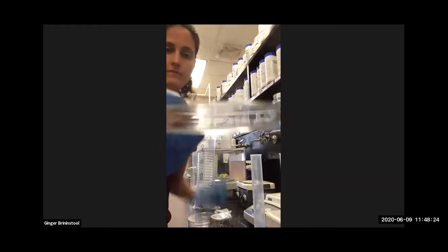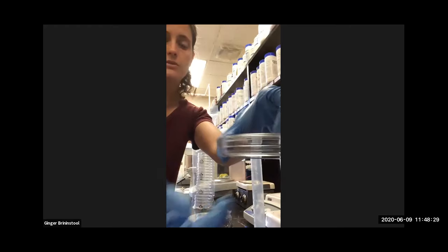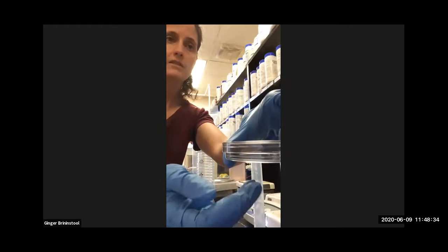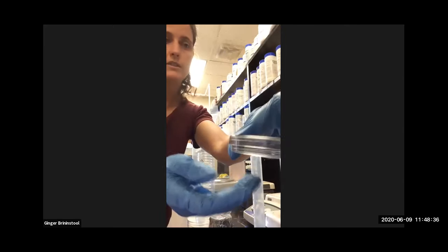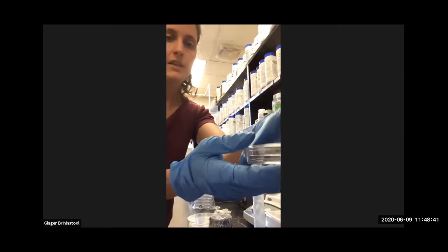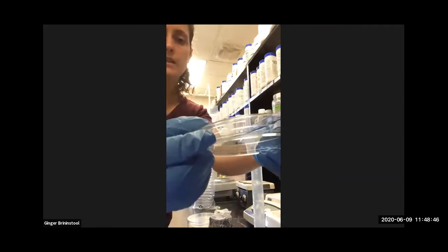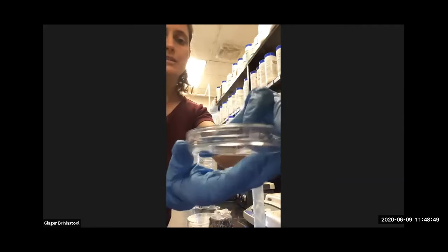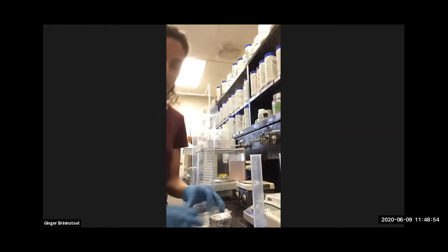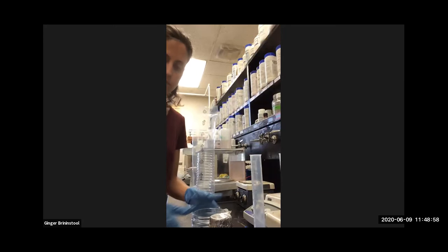So here's an agar plate. It's plastic. These are plastic ones. They make glass ones too that you can clean and reuse. Those are more eco-friendly in one way in that you don't throw away plastic, but you have to wash them with soap and water and sterilize them. And so energy-wise, probably a toss-up. All right, so plates are like this. There's a lid and there's a bottom. The lid is bigger than the bottom so that it can sit on top comfortably. All right, lid is up always when you pour the plates because you want to pour the agar into the bottom of the plate, right?